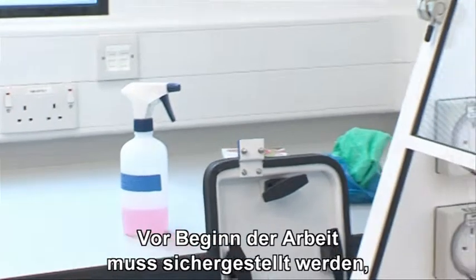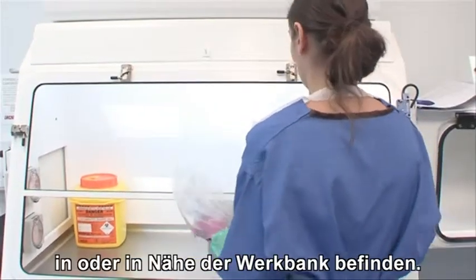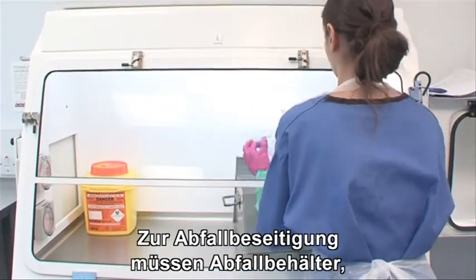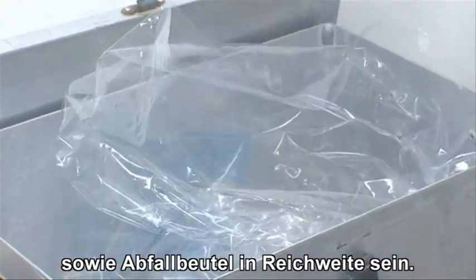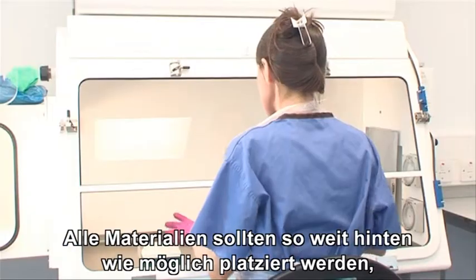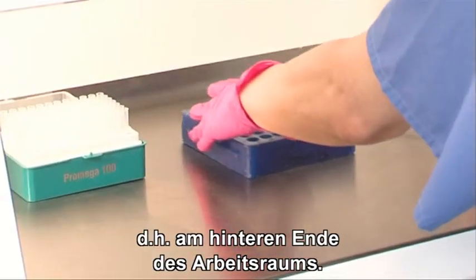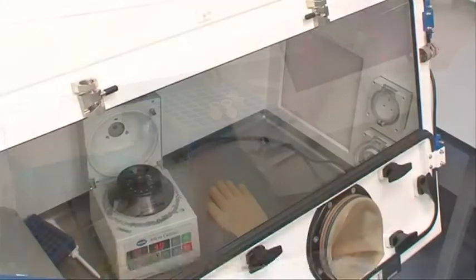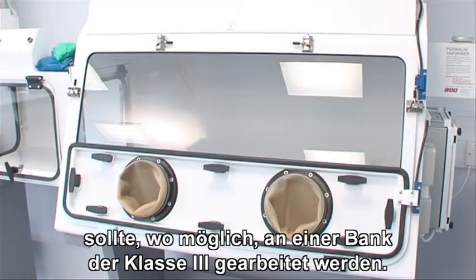Prior to commencing work, laboratory staff must ensure that in-date decontamination materials are available in or near the cabinet. Disposal methods required, such as a sharps bin, decontamination tank and waste bag, must also be available. All materials should be placed as far back in the cabinet as practically comfortable, towards the rear edge of the work surface. For equipment that is aerosol generating, such as mixers and centrifuges, a Class 3 cabinet should be used where possible.